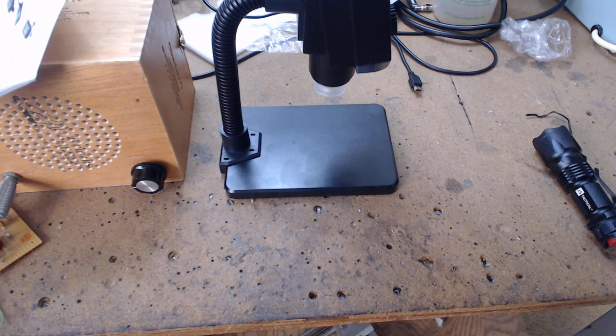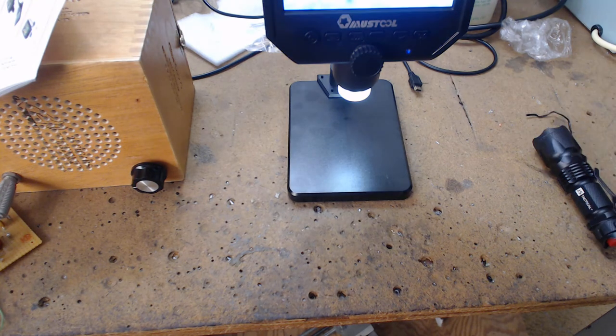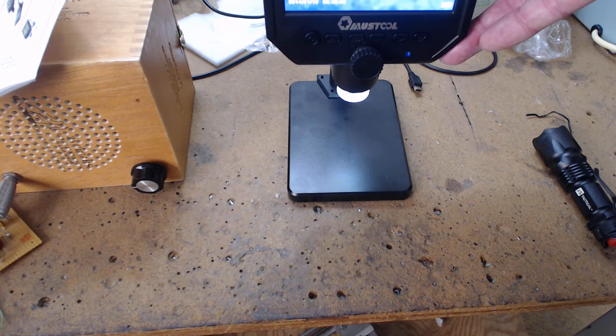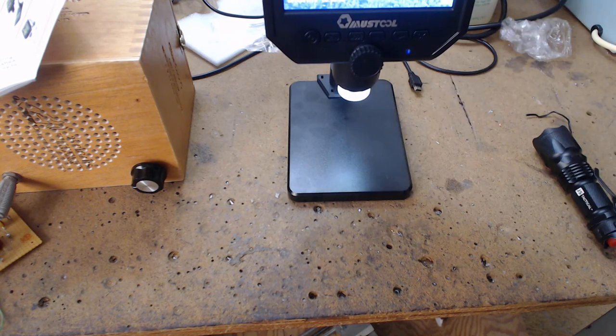See, on this thing here, it's got a battery built into it. It'll basically record what you're doing. There is a knob behind here. I could change the brightness, okay? And the knob barely comes out to the surface behind here. It's very poor build quality, but that's the way the world's going.